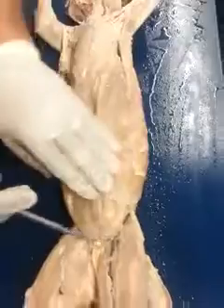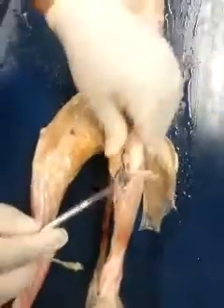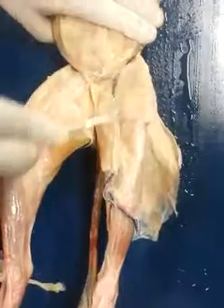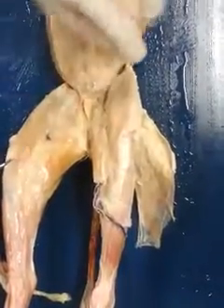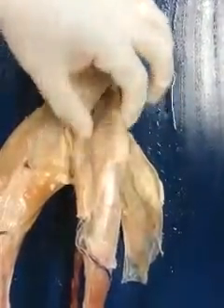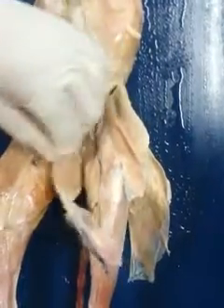As we move down from there, we get to the thigh. So in the superficial muscles of the thigh, initially you would just encounter the sartorius and the gracilis. Now note that in humans, the sartorius and gracilis are not as wide. They are thin band-like muscles that run in the same direction, but not as wide. So this is the sartorius, and here's the gracilis.